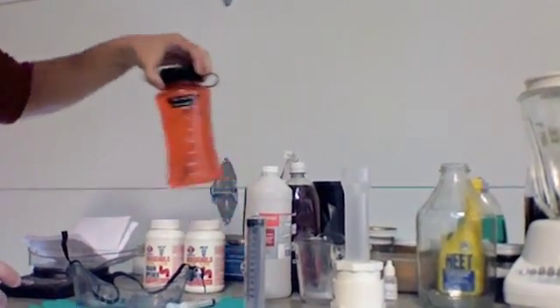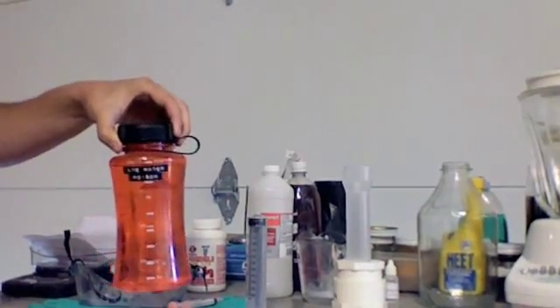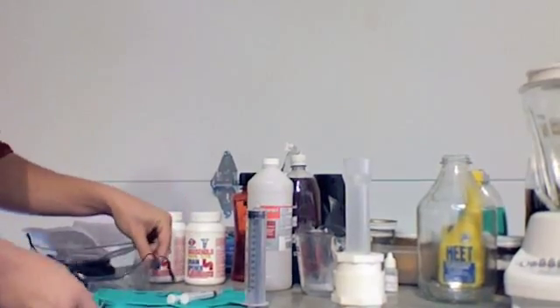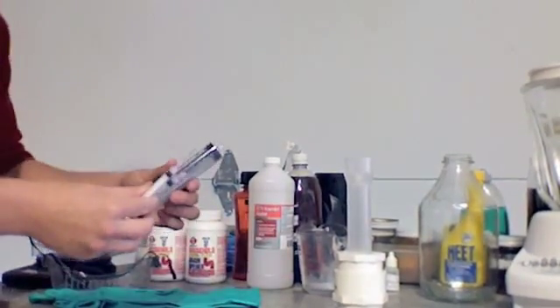Lye water, which is one gram of lye to one liter distilled water. Safety glasses, gloves, syringes in two sizes.